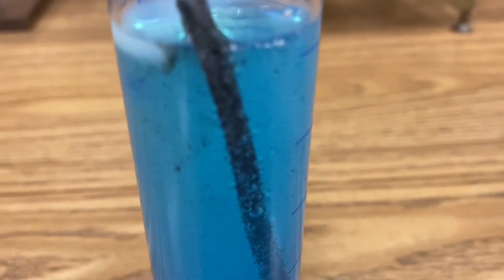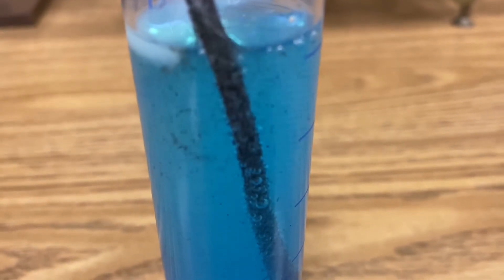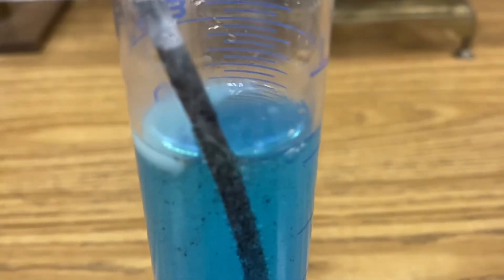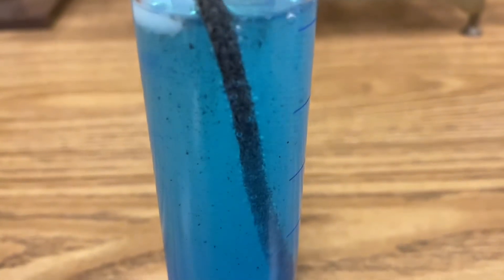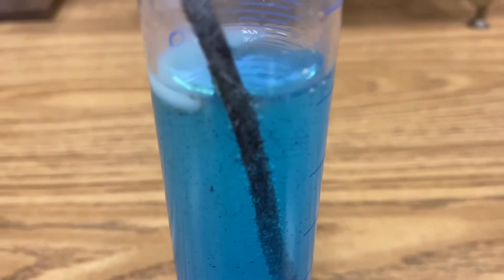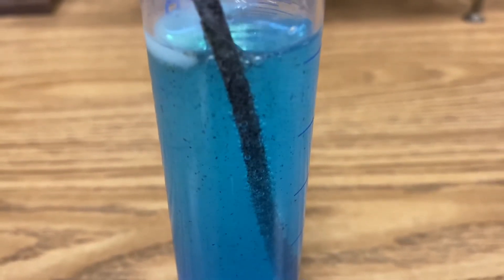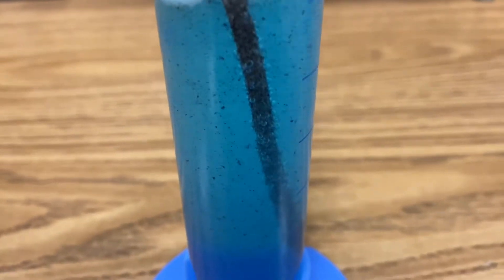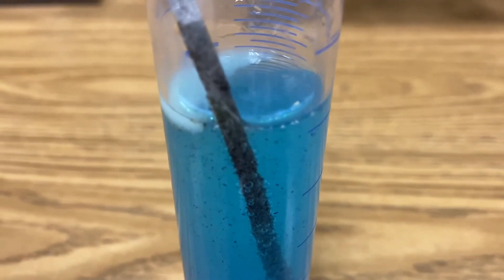Right away you'll start to see the oxidation of the magnesium, and this is because magnesium is so much more reactive than copper. And at the same time you also have a reduction reaction. Those little bubbles that you see rising is hydrogen.